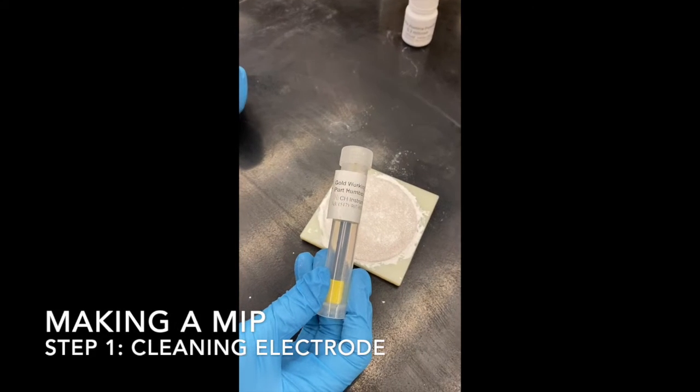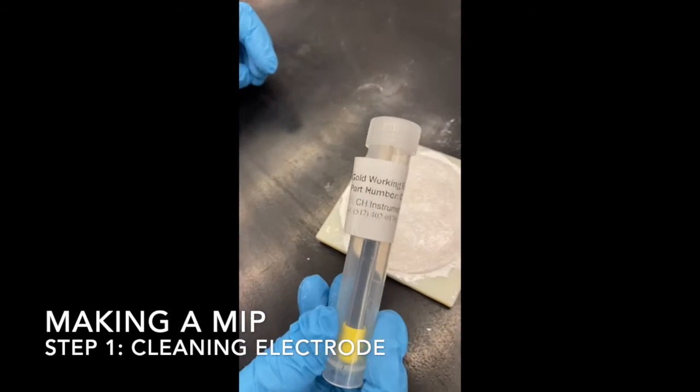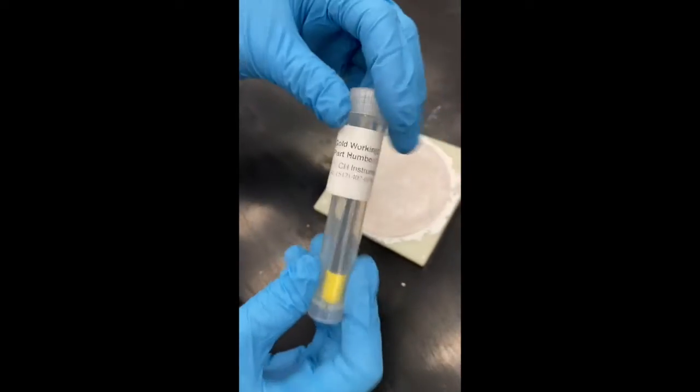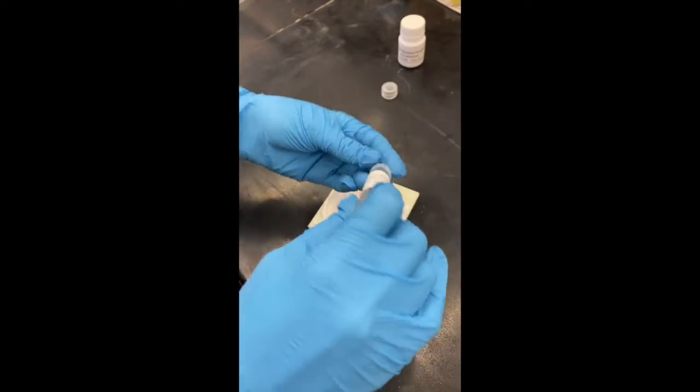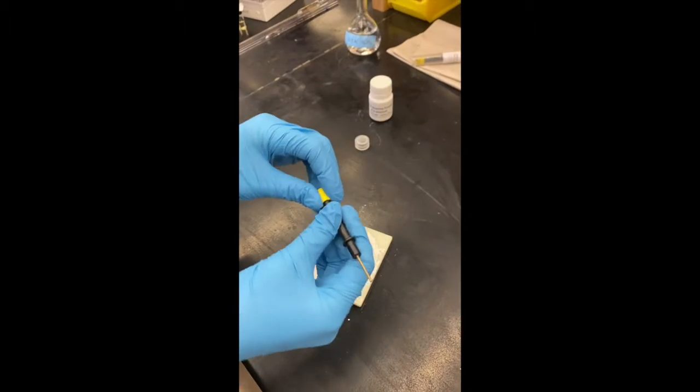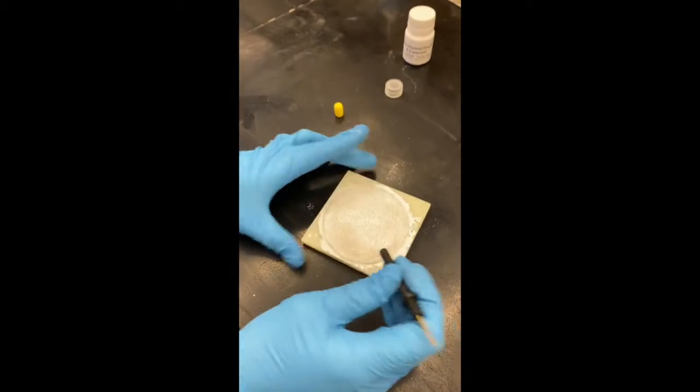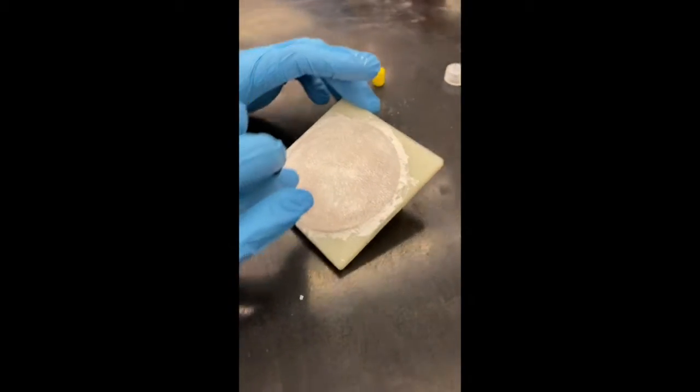So step one is going to be cleaning the electrode before we do the MIP deposition. So I have a gold working electrode here. I'm going to take it out of its container. And we're going to start by rubbing it in small circles on this microfiber pad.